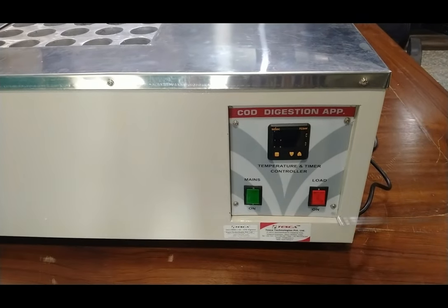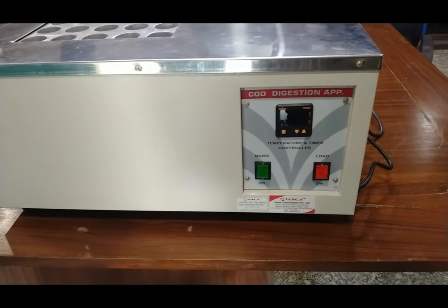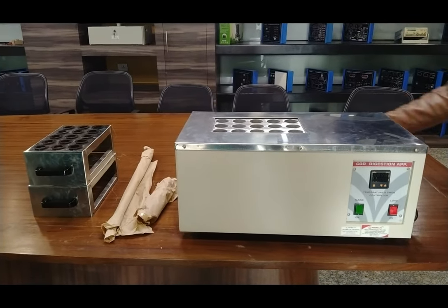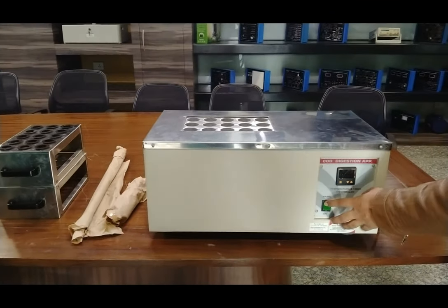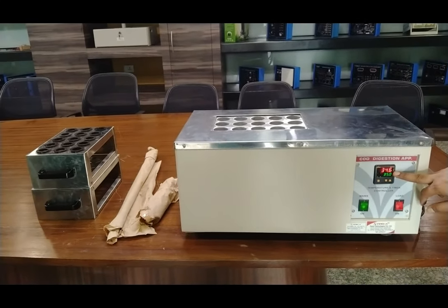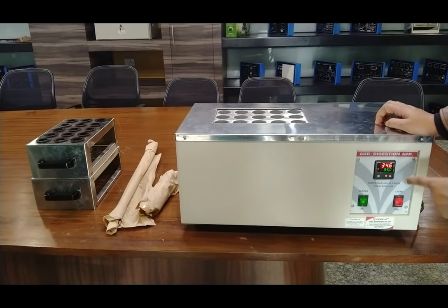This is a COD digestion apparatus and now we are going to operate it. To turn on, connect it to 230 volt AC mains and turn on the mains. The PID controller display will turn on, and here we can set the temperature as per our choice.